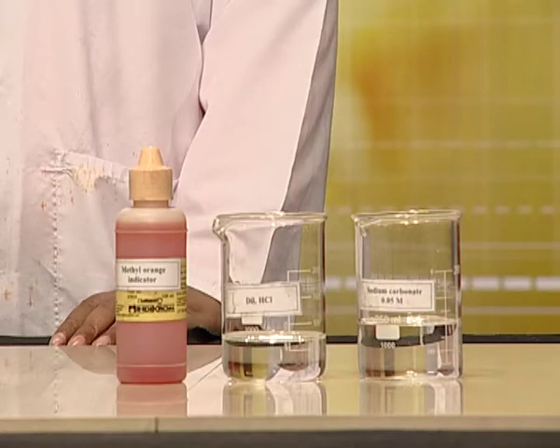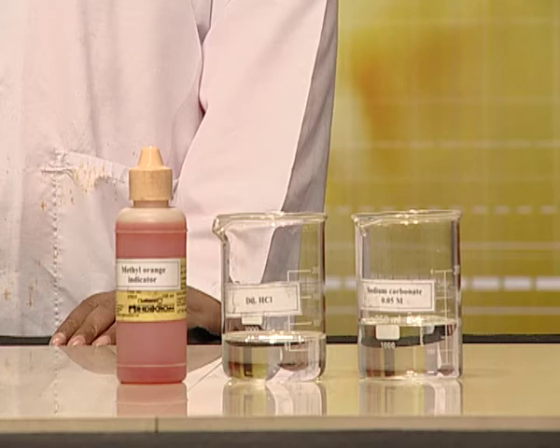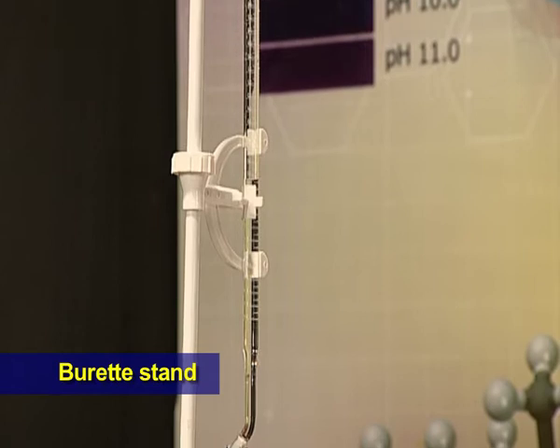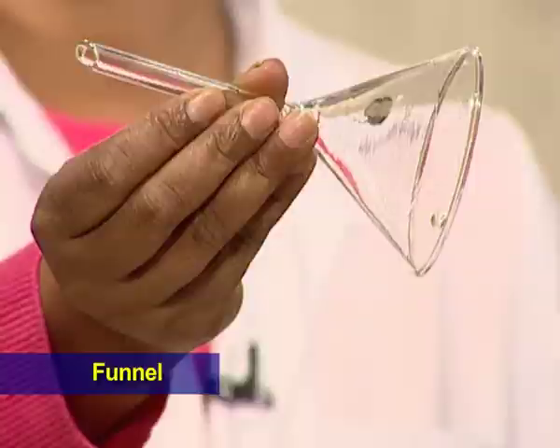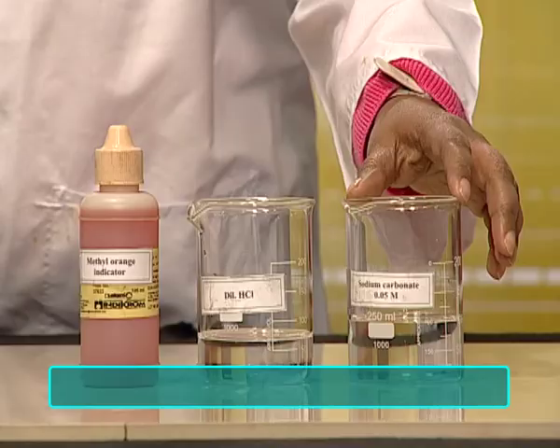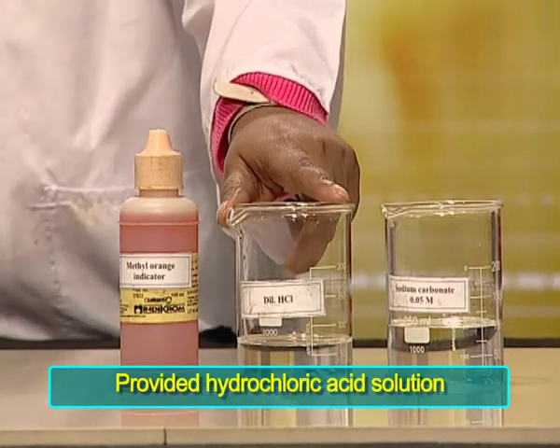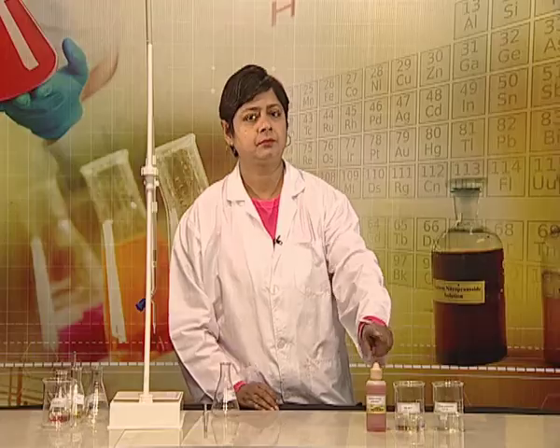The materials required for this experiment are: for the apparatus, we need a burette, pipette, conical flask, burette stand, funnel, and a white glazed tile. The chemicals required are 0.05 molar sodium carbonate solution, the provided solution of hydrochloric acid, and methyl orange indicator.